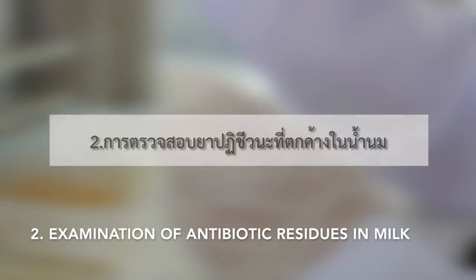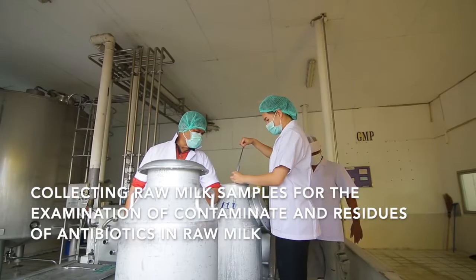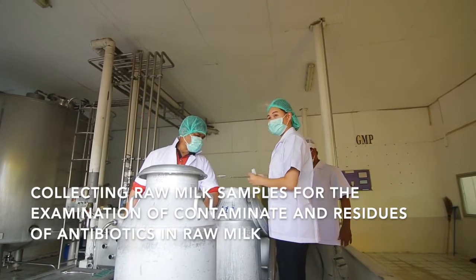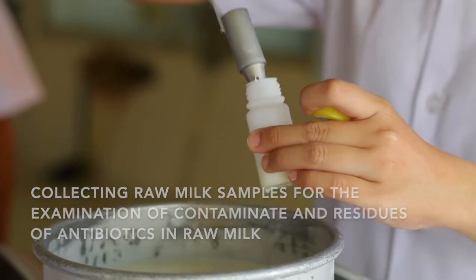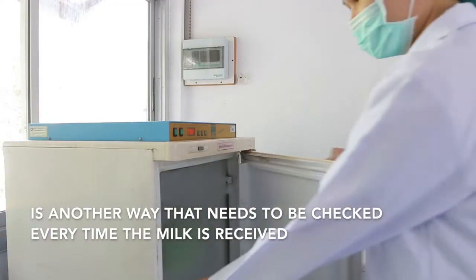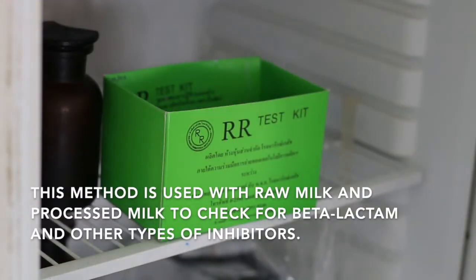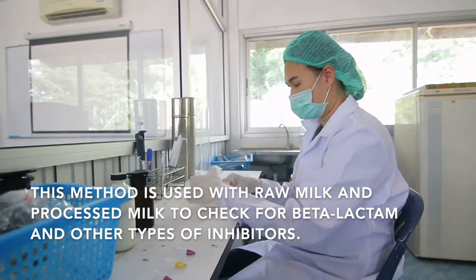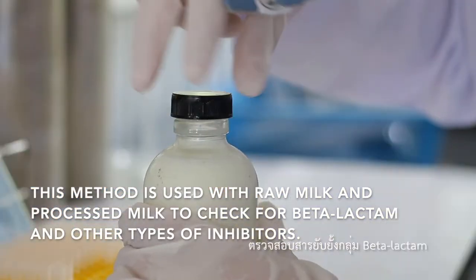Second, examination of antibiotic residue in milk. Collecting raw milk samples for the examination of contaminants and residue of antibiotics in raw milk is another check that needs to be done every time the milk is received. This method is used with raw milk and processed milk to check for beta-lactam and other types of inhibitors.